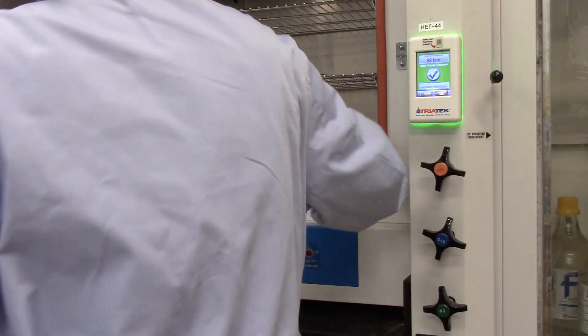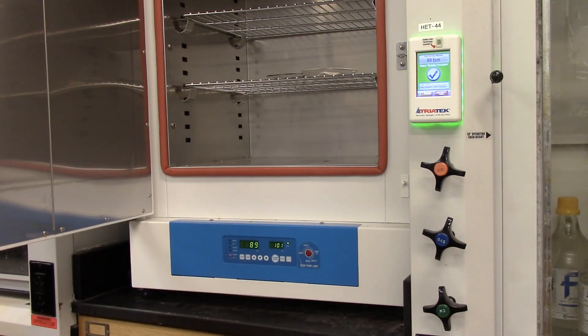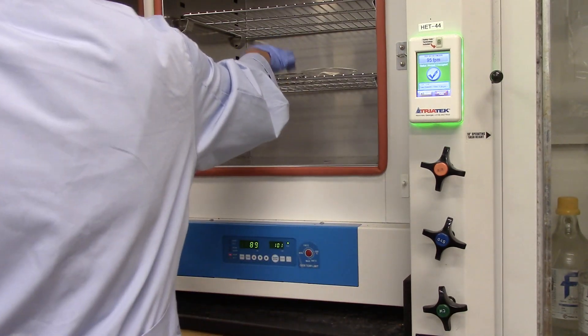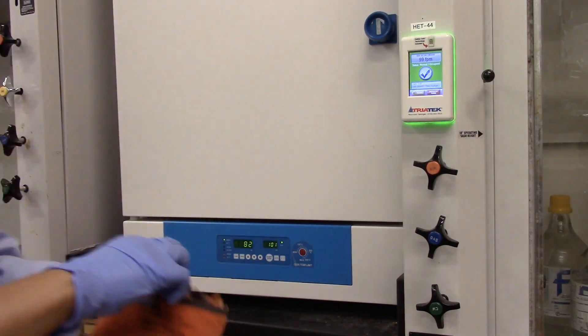Aniline product and acetanilide product into the oven to dry. So let's take out our dry product.